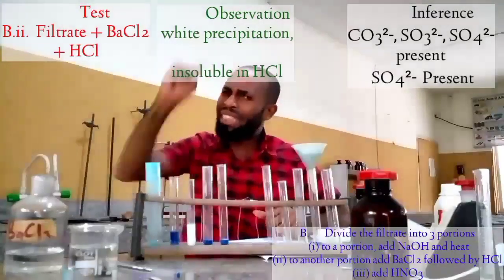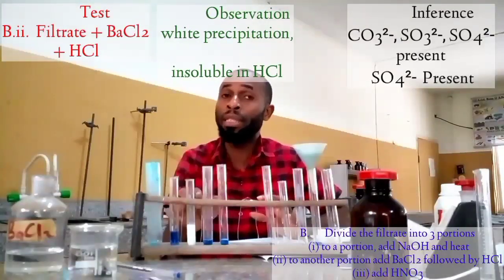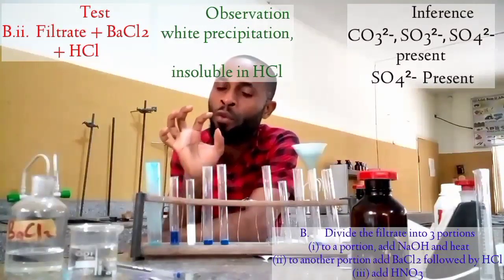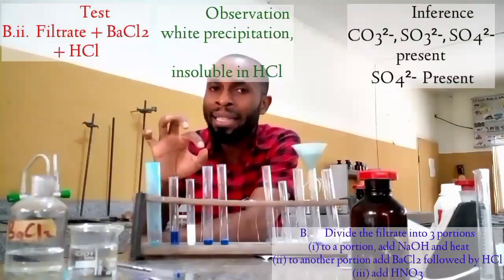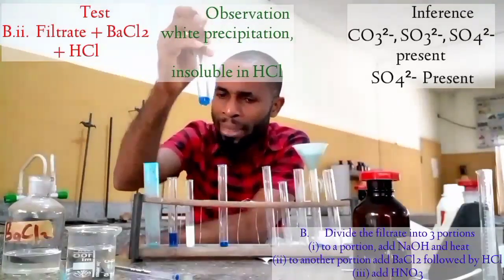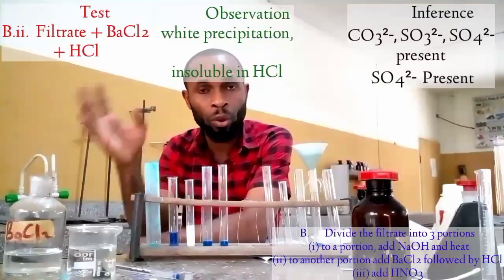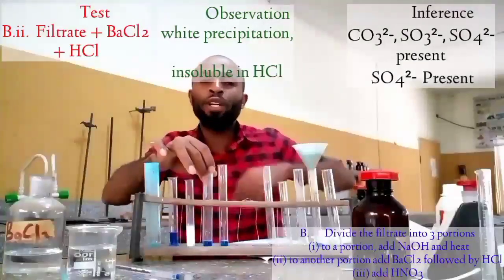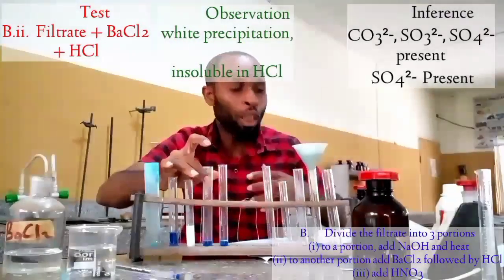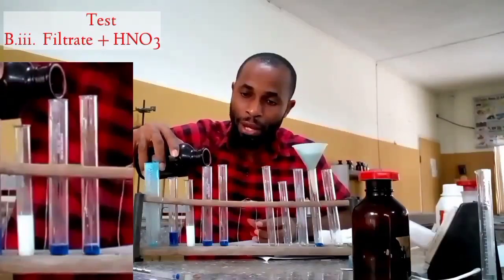Do you get me? Okay, but at the same time, there are still some portions of carbonate in this. And for us to prove this, which I believe WAEC might not ask, we need to add HNO3, that is trioxonitrate(V) acid, to any of the portions. We are going to have evolution of gas, and this gas turns moist blue litmus paper to red, and also turns lime water milky. That is, if for instance they ask you in the filtrate to add HNO3, they are trying to confirm what I said about carbonate being in this solution. Let's add this and watch as there is a change here.